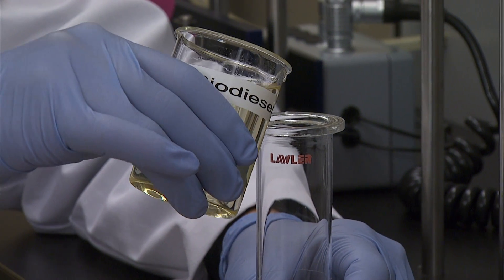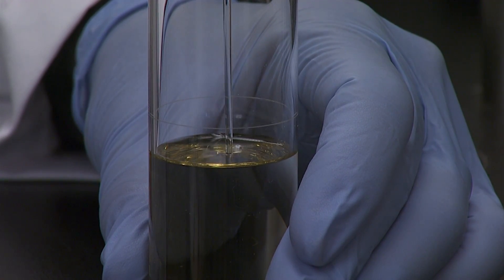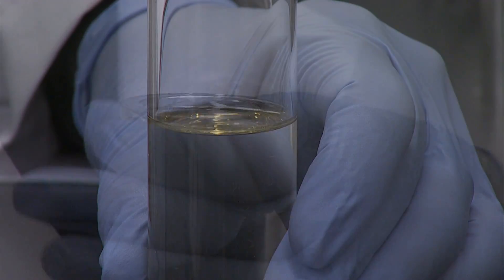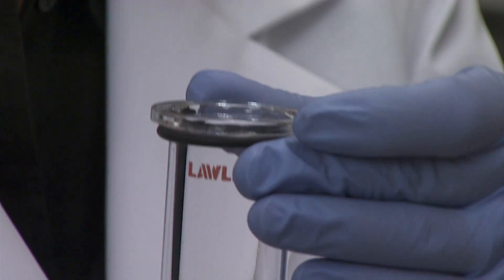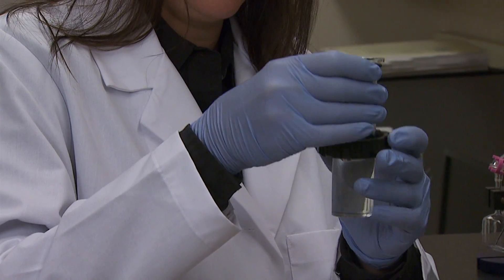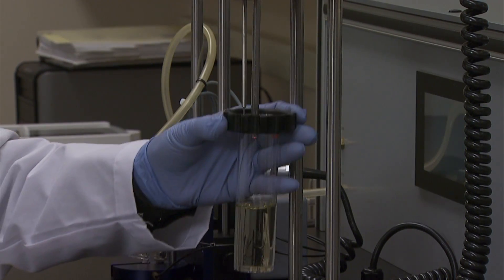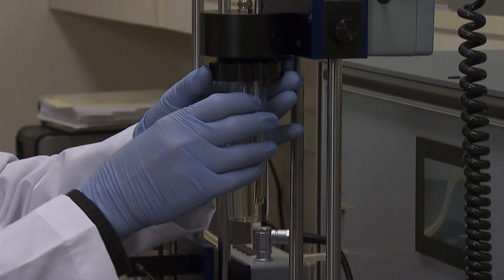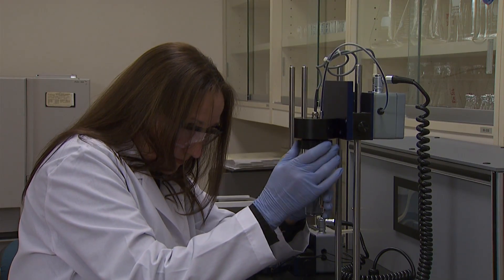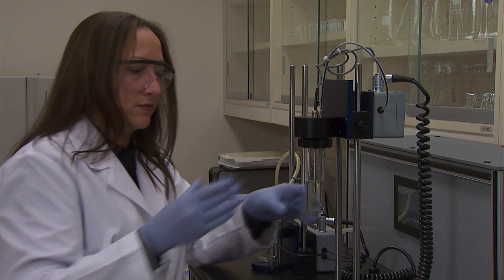All samples should be at room temperature before beginning the test. Fill the test jar with the sample exactly to the line. Slide the O-ring and the threaded plastic collar onto the test jar with the smooth side facing down and the threaded side facing up. Lifting the jar by the plastic collar, gently raise the jar up to the temperature and test probes until they are submerged in the sample.